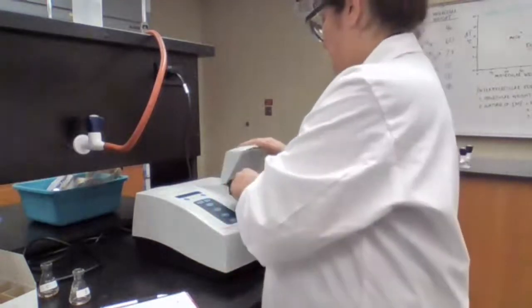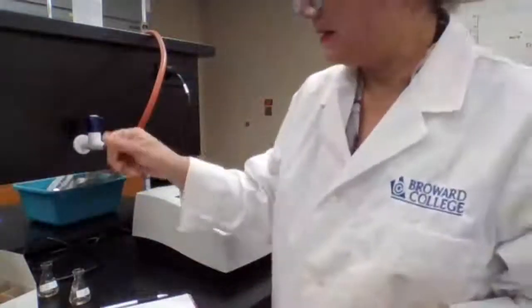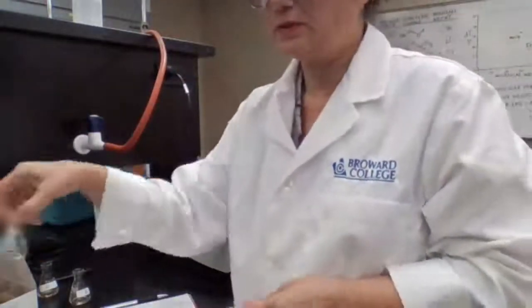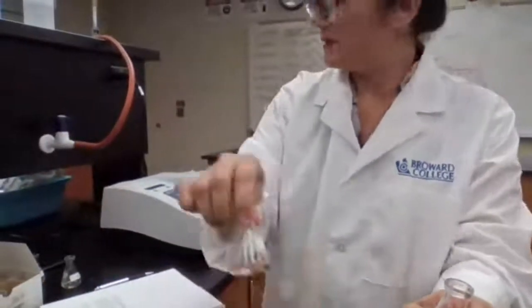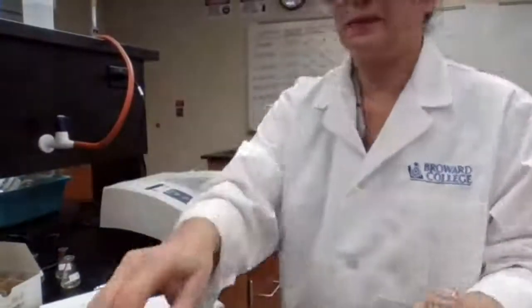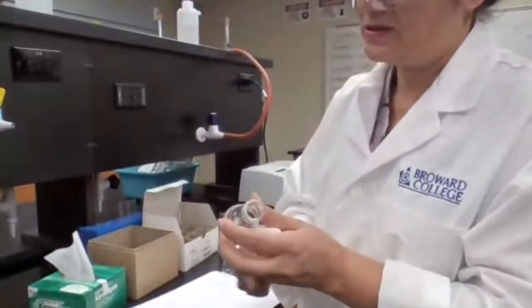Perfect. Take it out and wait until 2:09 for my sample to be ready. Sample D is done. Sample E is next, and the time that I need for that is 2:09, 5 minutes' time.